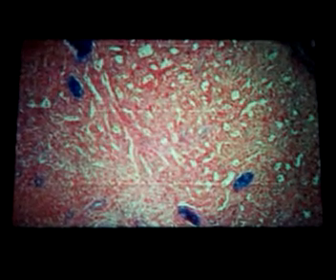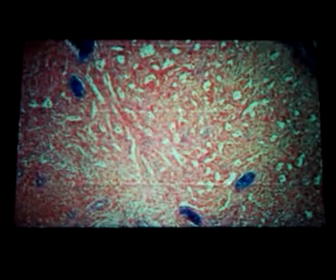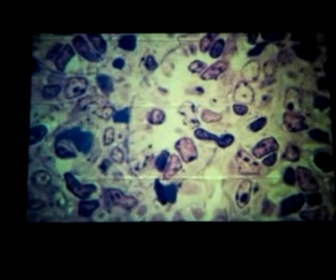This will be your medullary cords. Again, these are the structures that are like the radiator in your room. These things are the trabeculae. This is where a lot of cells move back and forth into the system. Right here is one of those in cross section. You can see all of your cells, or quite a few of them, becoming amoeboid and working through those areas. So again, you have the macrophages as the clear ones, the lymphocytes as the dark ones. And this is a resin section, so things are really, really thin here. So much more clear.